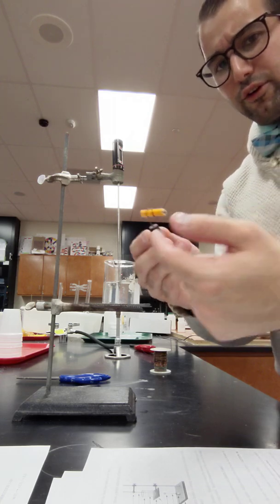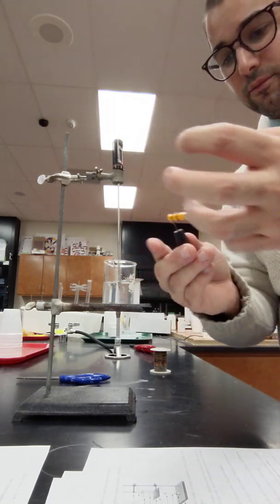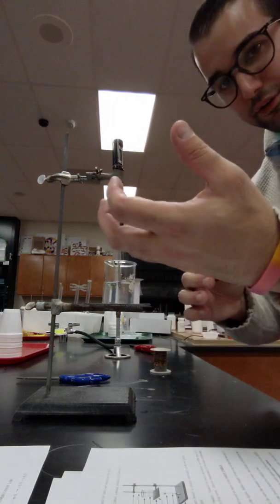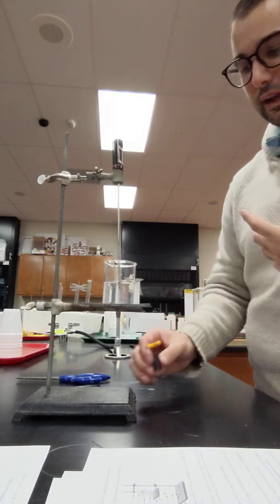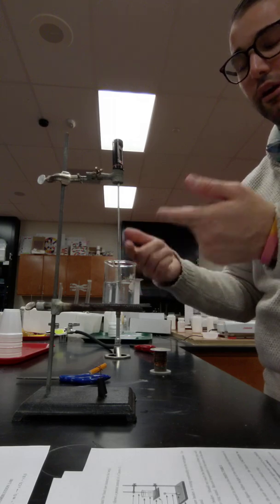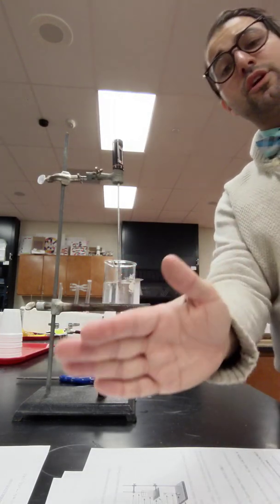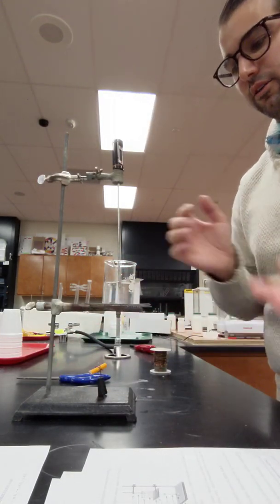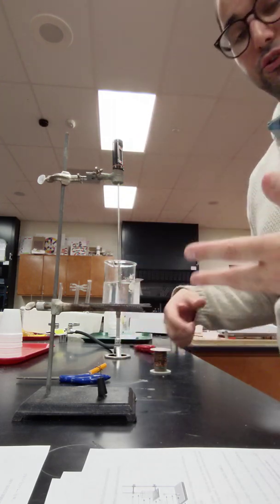Now just be careful make sure that you're able to have it in the rubber stopper that it'll stay standing still up because what's gonna eventually happen is you're gonna put this Cheeto, let's pretend this orange pencil is my Cheeto. You're gonna put this Cheeto over a flame and it's gonna go on fire and then it's gonna burn kind of like you're burning food in the body and as it's burning it's gonna transfer heat into your water and change its temperature. So you're gonna follow the procedure exactly on how much water and what to do but I just wanted to quickly show you.